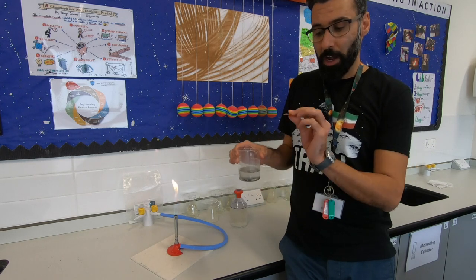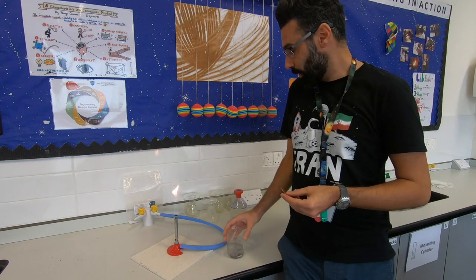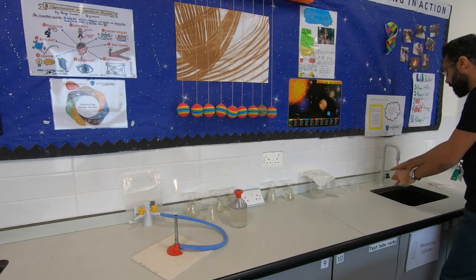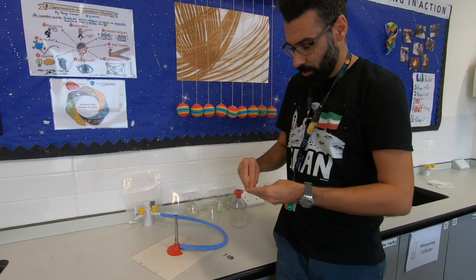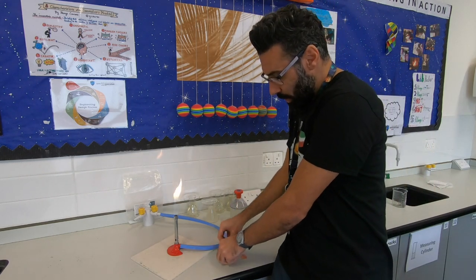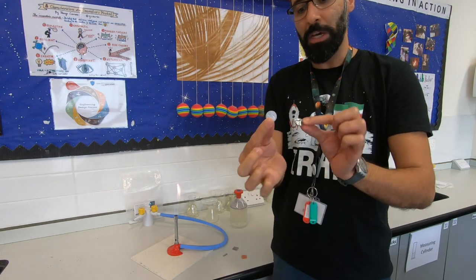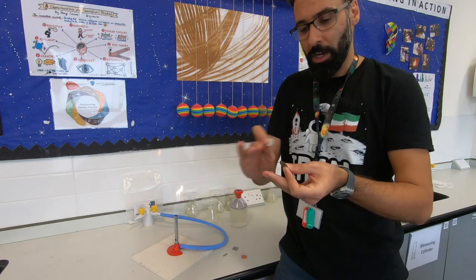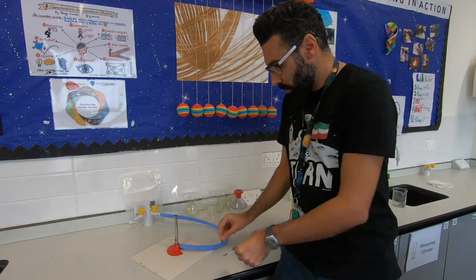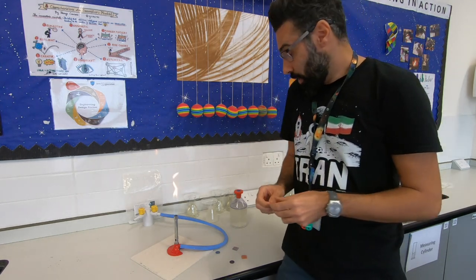The coins and the piece of copper I put inside the solution are ready. They've turned to silver color. It's cold enough now so I can rinse them and take the coins out. Here is the copper plate turned completely to silver. One of them is darker because the copper wasn't very clean — make sure you use sandpaper to make it shiny before using it. Another small strip of copper I had also turned to silver color.